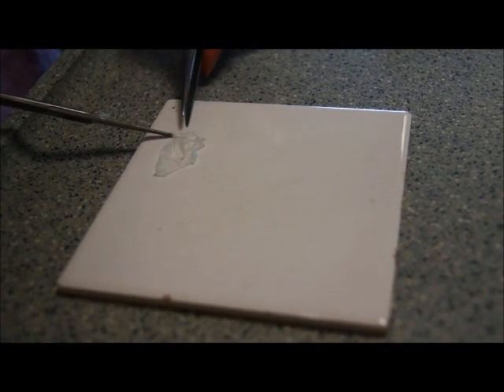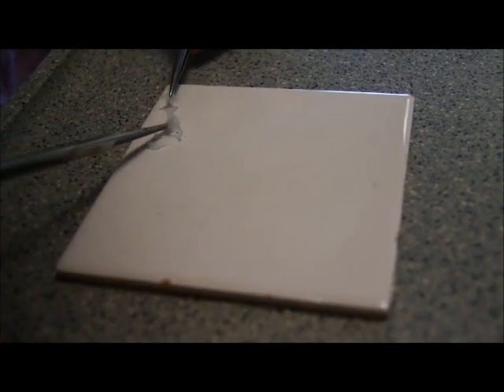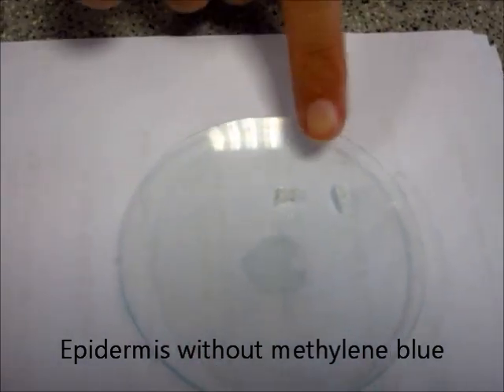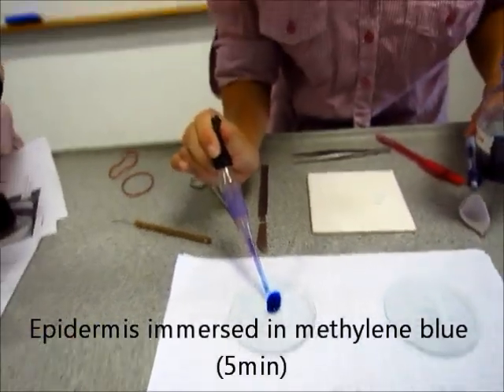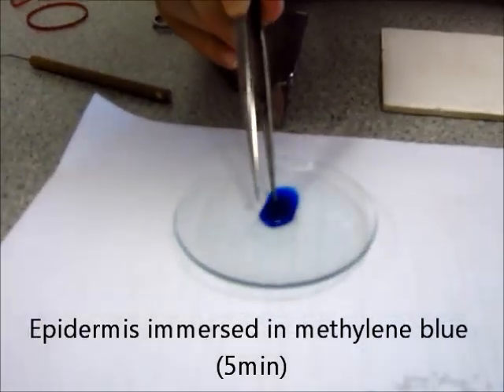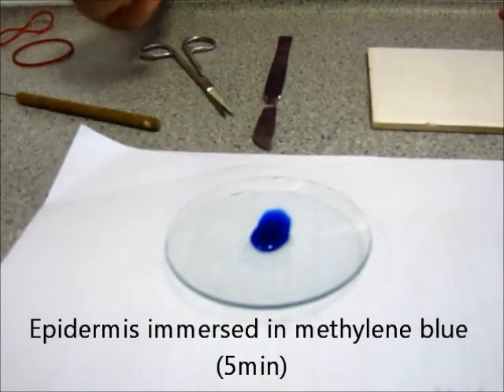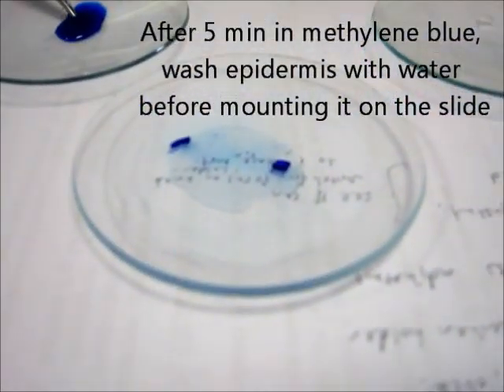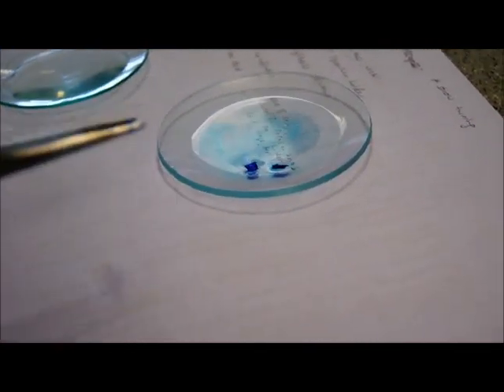We need two pieces. One to soak in the methylene blue and one to just leave it as it is. So for one of them, we will just leave them as they are. We will view them like that under the microscope. And for the other one, just cover it with some methylene blue. You can use the forceps to make sure that the epidermis is well submerged. You just leave this for five minutes after which we will take it out and wash it in water. So, five minutes is over. Take out the piece of epidermis and wash it in some tap water.